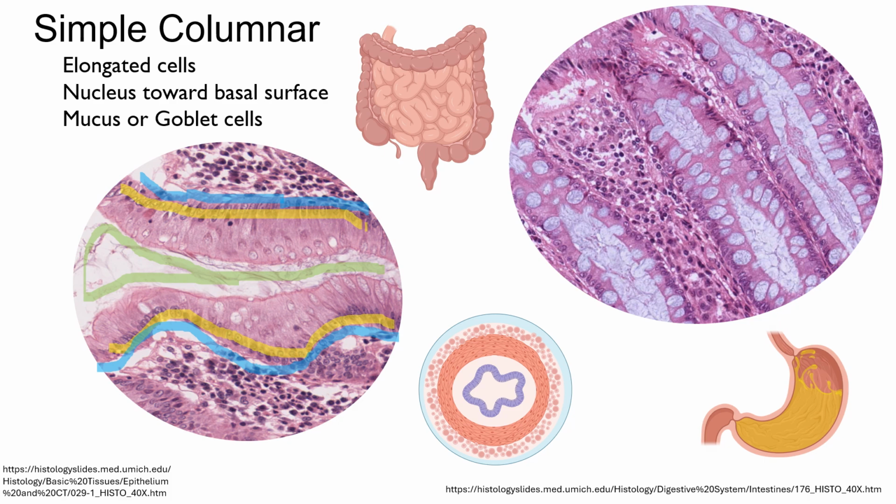In the digestive system and in many mucous membranes, remember, mucous membranes are open to the outside, there are cells that are called mucus cells. They used to be called goblet cells. I like their name mucus cells because that's what they make, mucus. Mucus doesn't like to take up a stain as much as some of the other things like cell membranes and nuclei. So mucus cells, they look like these scattered blobs in among the simple columnar cells.